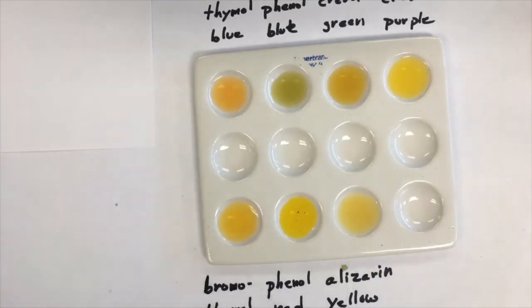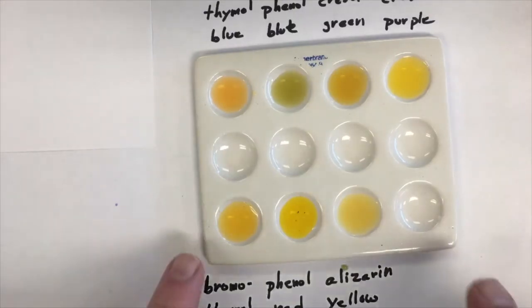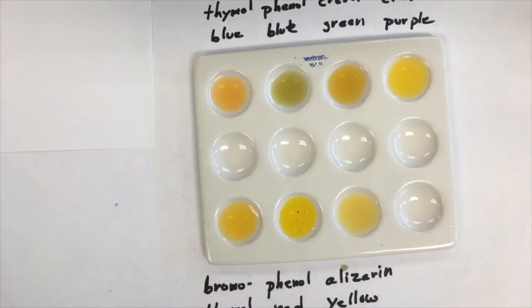I have, I've forgotten to mention, but what I do in between each solution is, the solutions are small enough that I can just rinse them down the drain. So I take the well plate and I rinse it with deionized water, dry it, and then use it again.